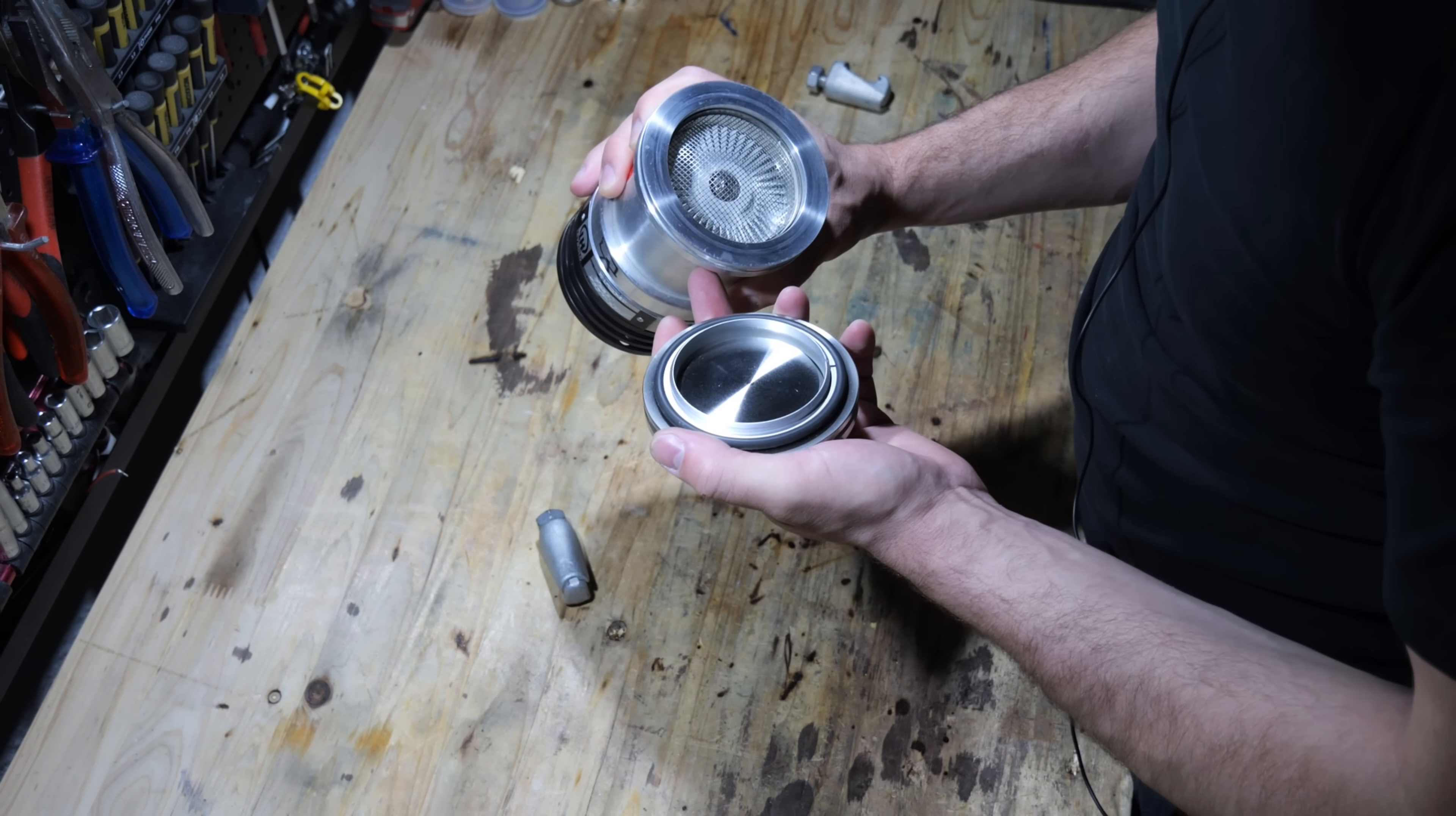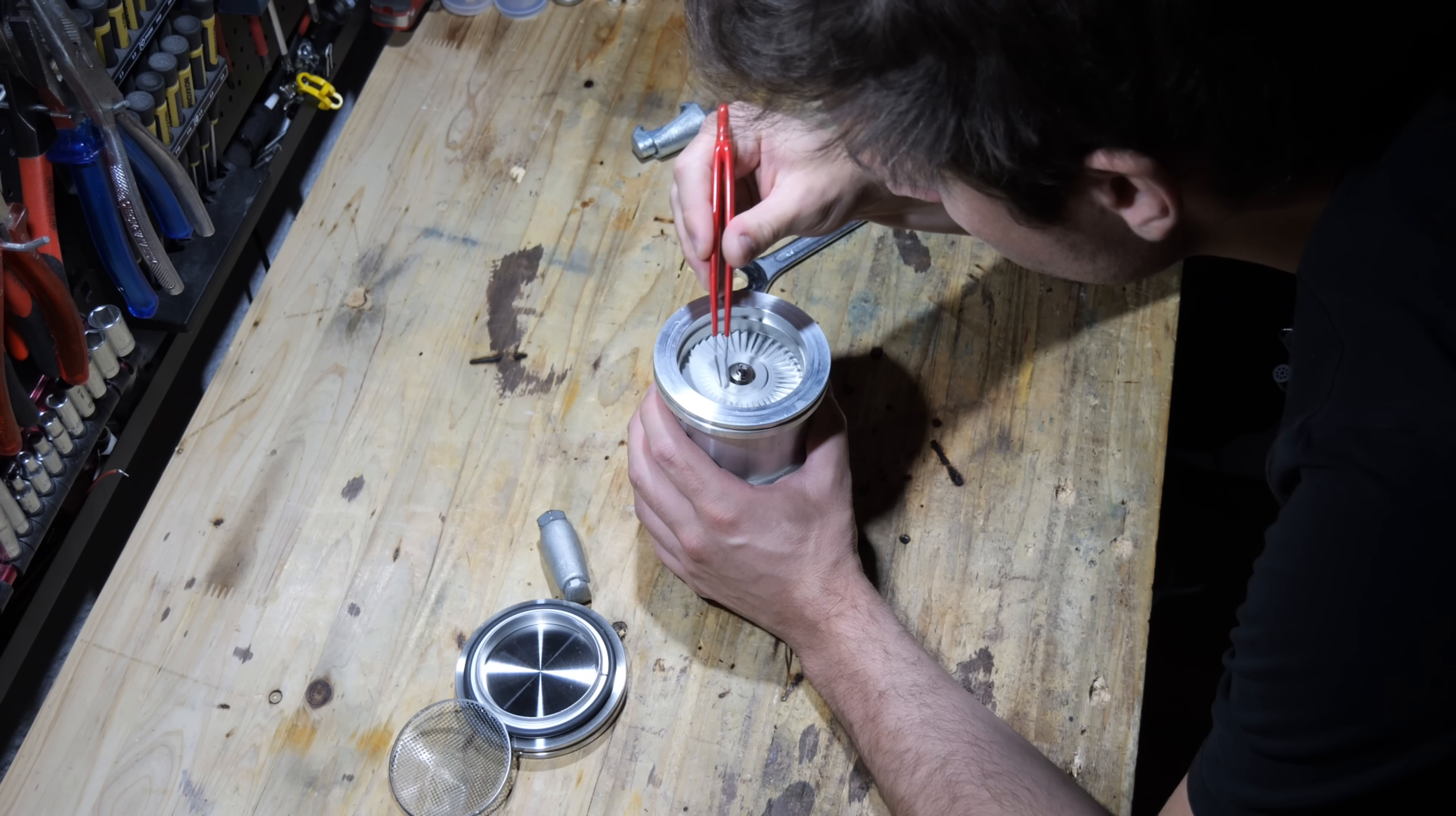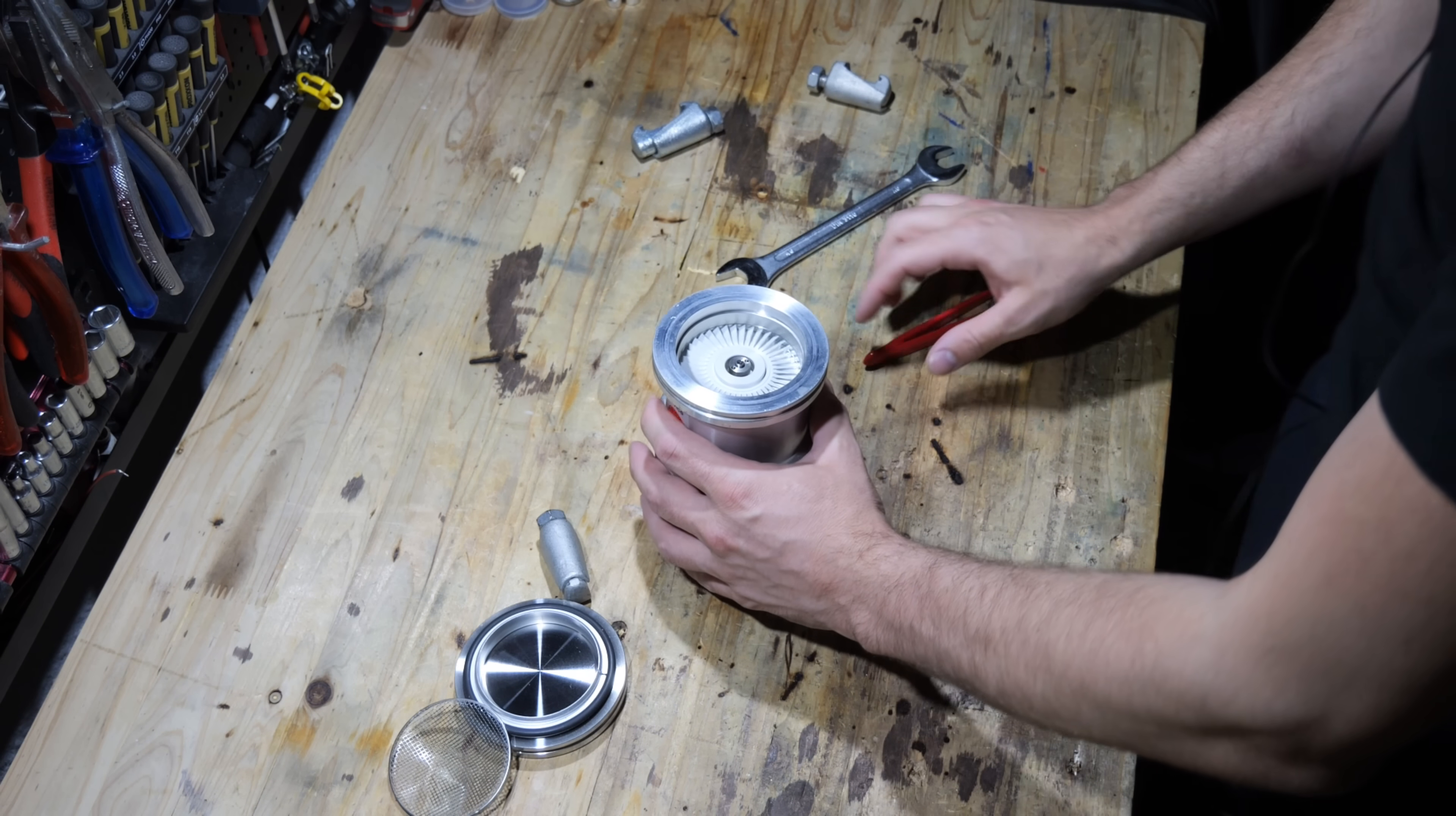In today's video I will attempt to investigate the issue with this pump and see if I can address all the problems. It is the same model I'm currently using at my vacuum chamber so that's very convenient. If I don't get this pump up and running again I can still use it for spare parts.